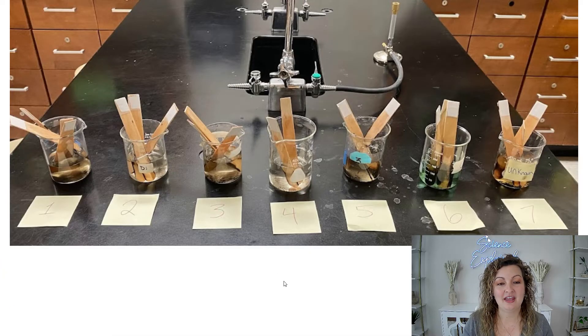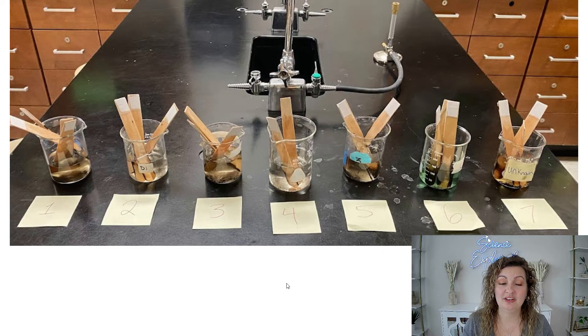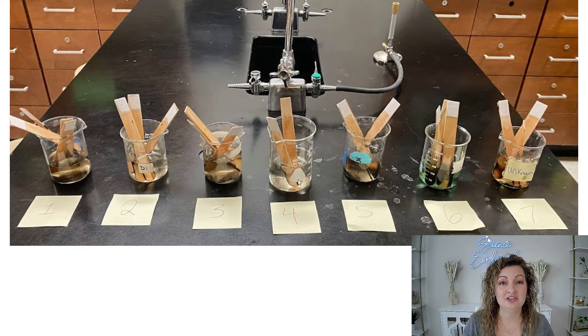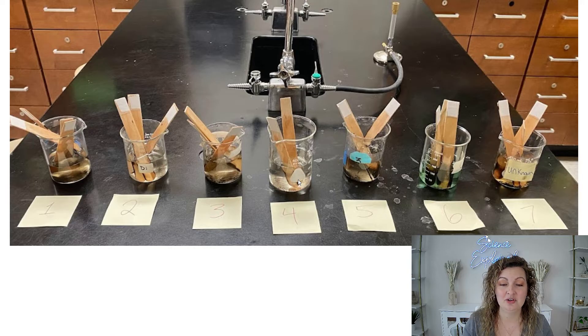So how I set this up, I set this up the day before we do the lab, and I go ahead and make an aqueous solution out of each of the chemicals that we're going to be testing. I crush them up and put them in some water.